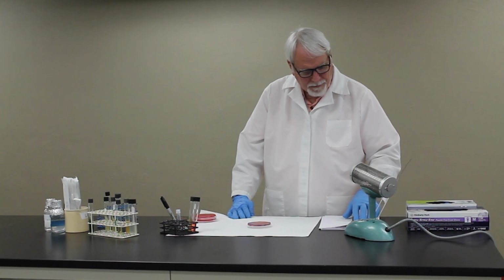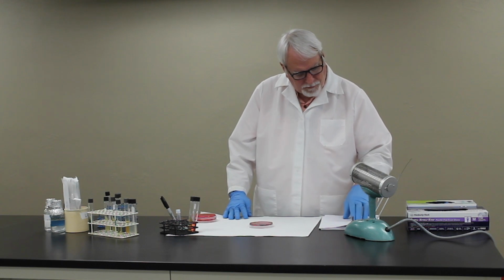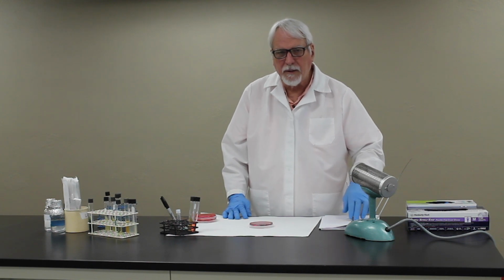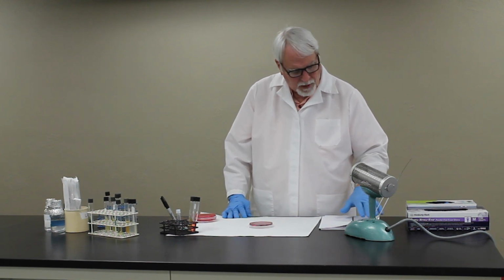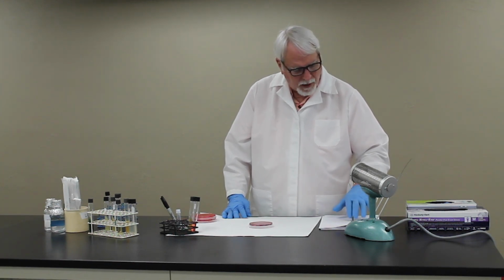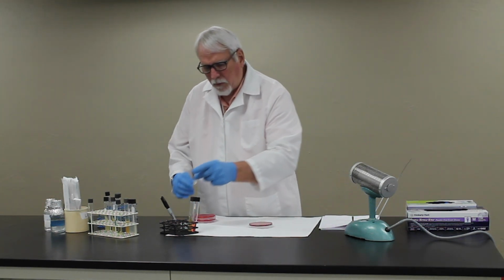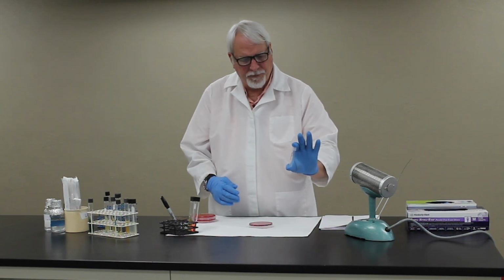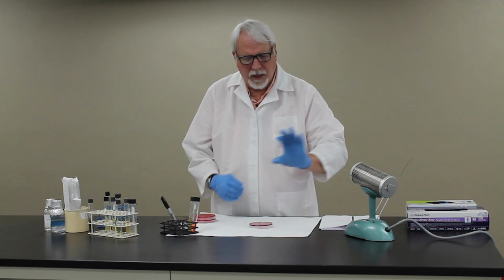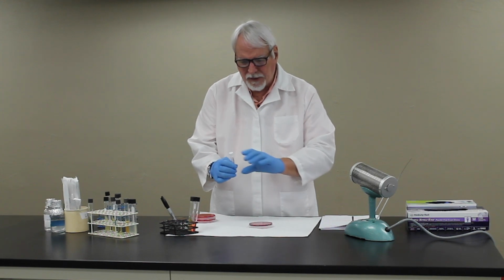The other thing that'll be a little bit different with this lab is we're going to look at the Catalase test as being important in separating the staph from the strep. So your Catalase positive organisms will be your Staphylococcus, and we're going to take those organisms that are Catalase positive and perform the Coagulase test. Coagulase is done using rabbit plasma. We'll have a slide Coagulase test that we'll be demonstrating in another video.